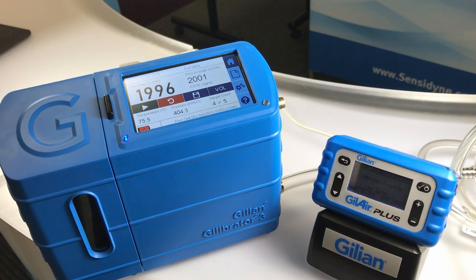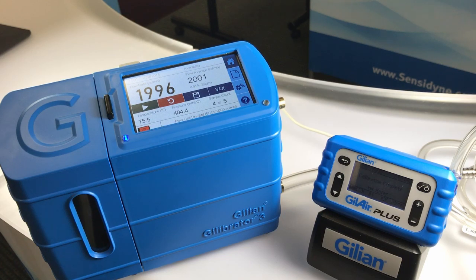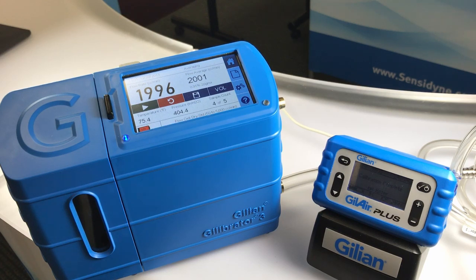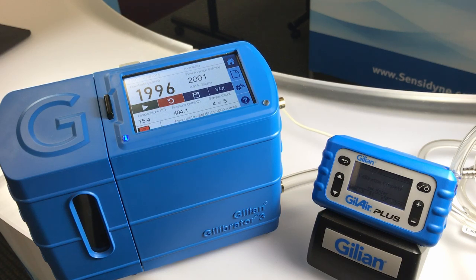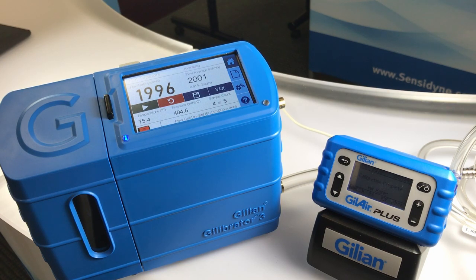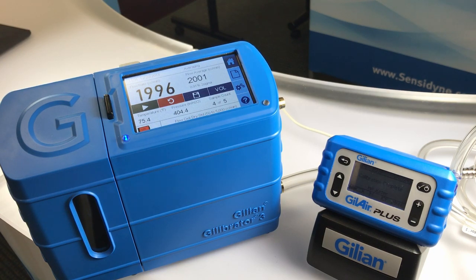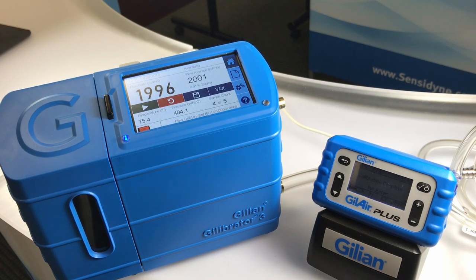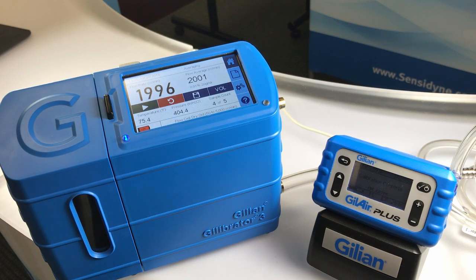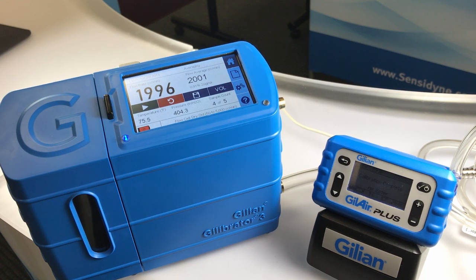We have now completed the calibration for this pump and it is ready to begin sampling. We will repeat this verification check during post-calibration at the end of the sampling event. We will give the sample the same name as the pre-calibration file and it will link the two together.